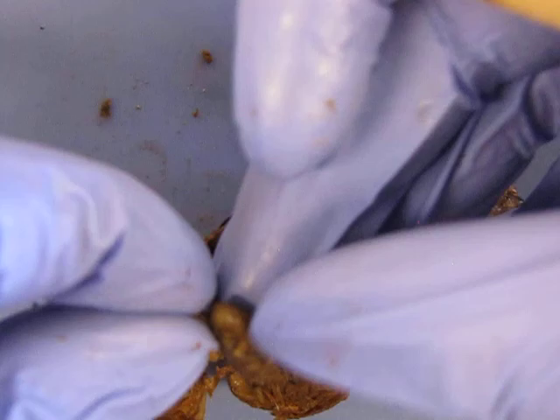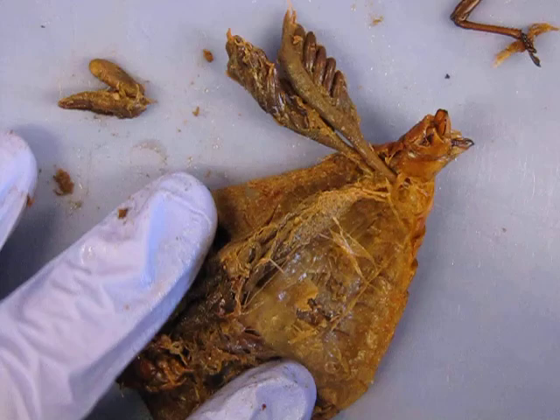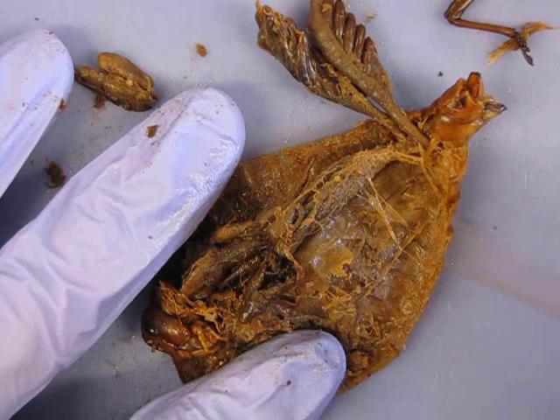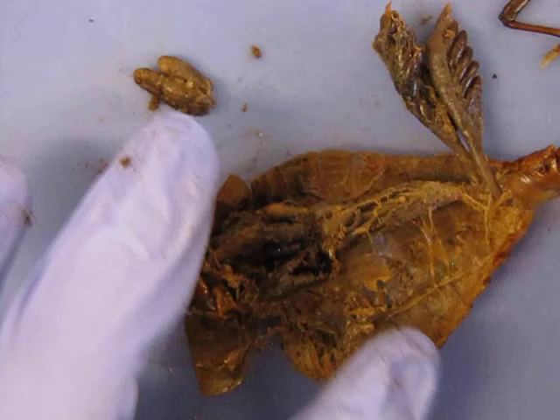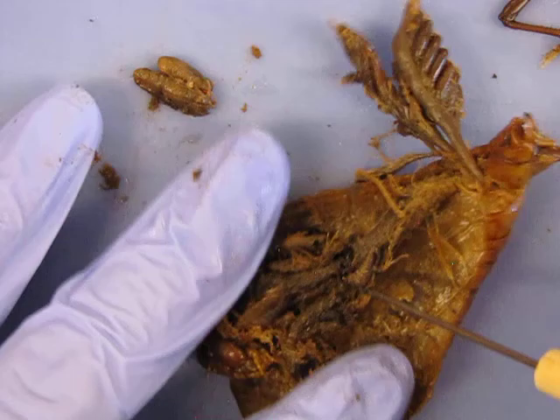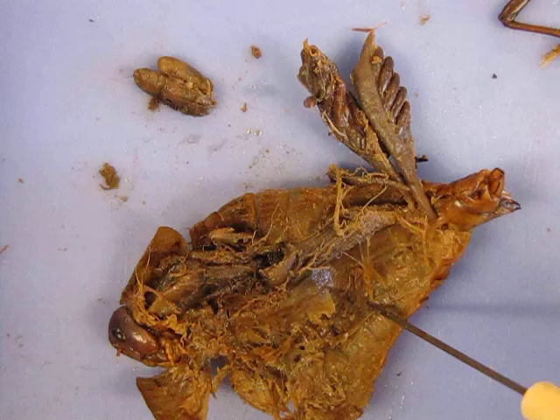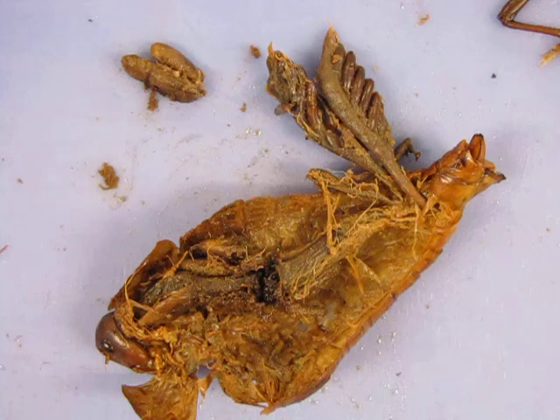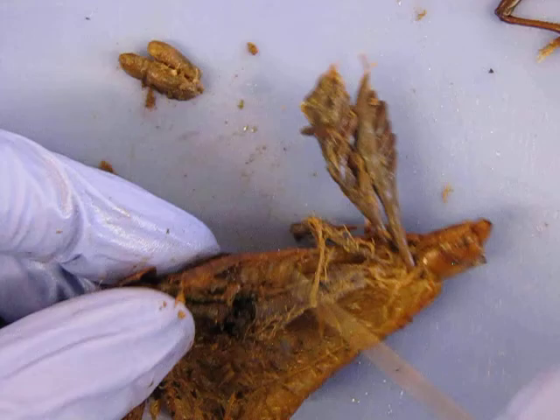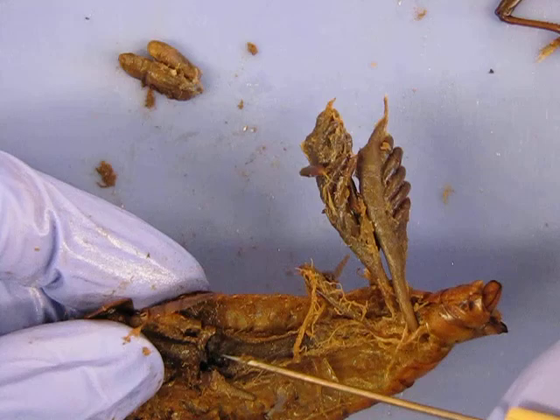They're individual projections — here I just took a couple of them off. You can see they're individual, all held together and covering the gizzard. The gastric ceca go both directions and they produce digestive enzymes that are secreted into the gizzard to get digestion going. So then after you are sure you can identify those, you can very carefully remove them without damaging anything else. Now here — and this is typical — I've compromised the digestive system and it's ripped open. That's okay, I can still see what's what, and I can also see the partially digested food in there.